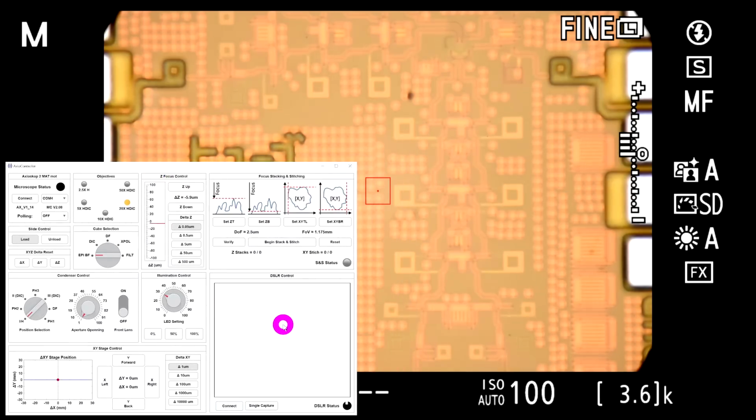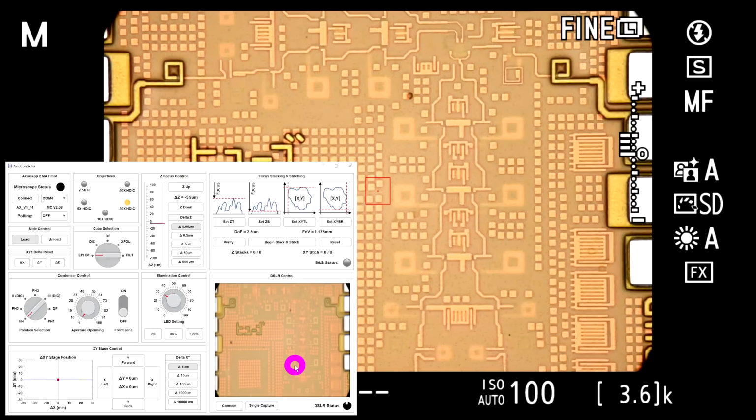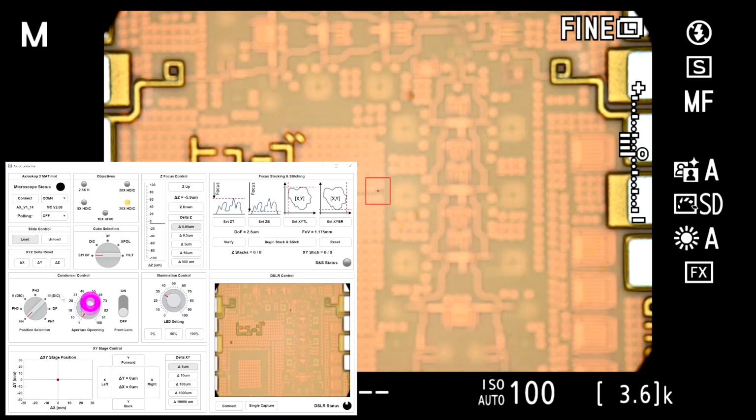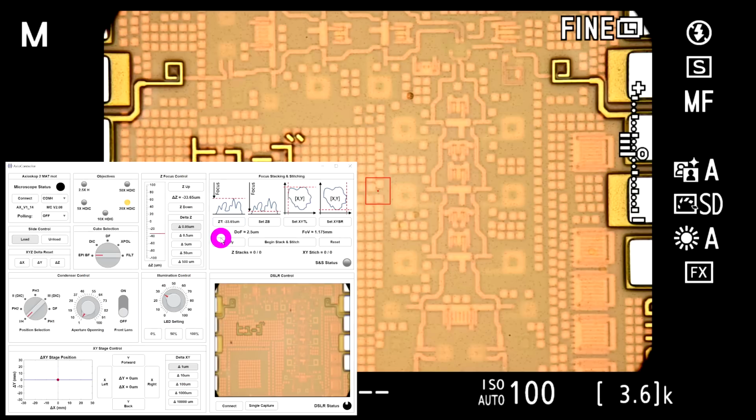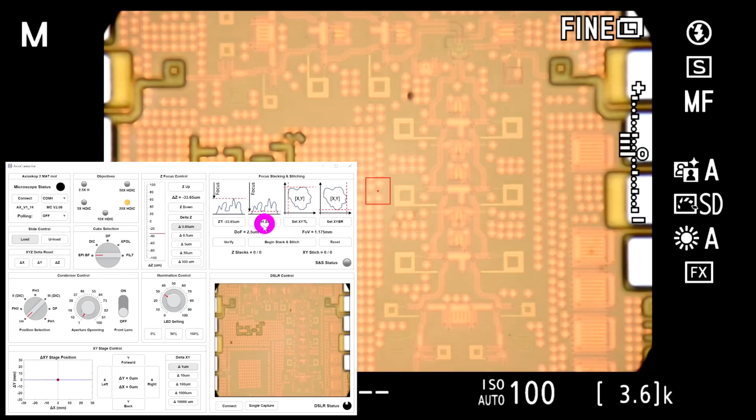So now that it is connected to the camera, I can do a single capture, like so. It takes one picture, and the picture should show up here any second. There it is. So it works. Now let's set that up and take a whole bunch of captures. First, we're going to go to the highest point, which is around here. We're going to tell the software that this is our highest point. We're going to go to the lowest point, which I think is somewhere around here. We go beyond that. There it is.